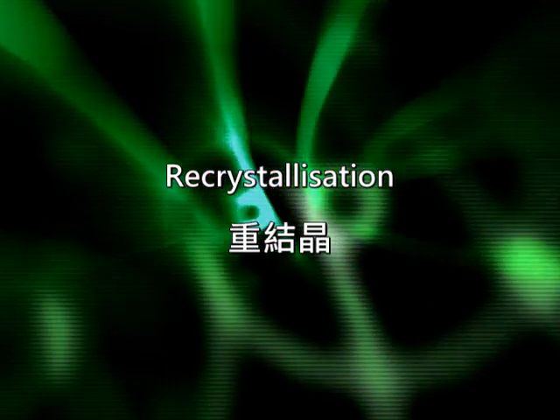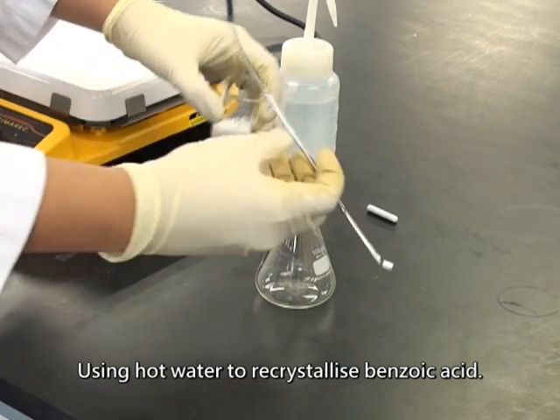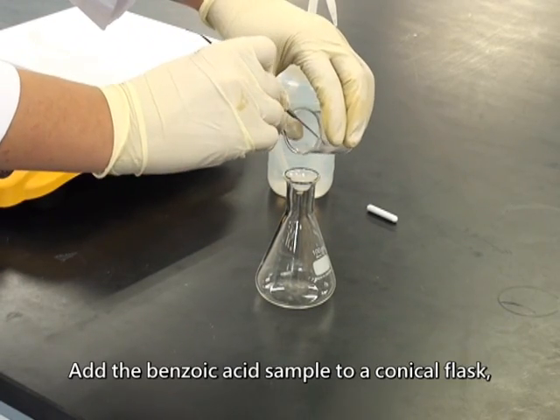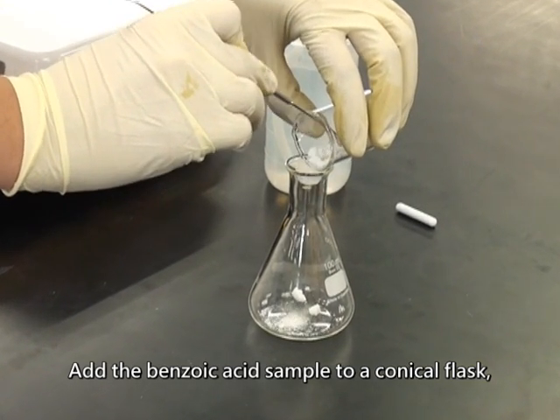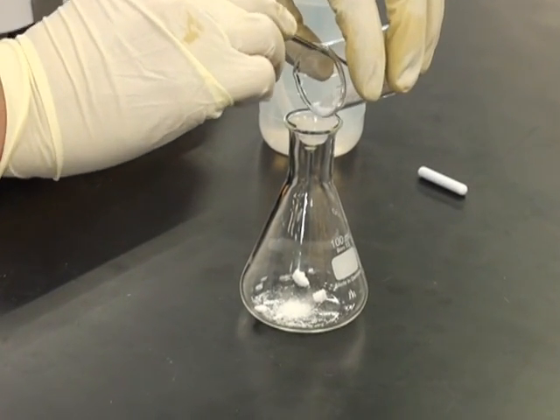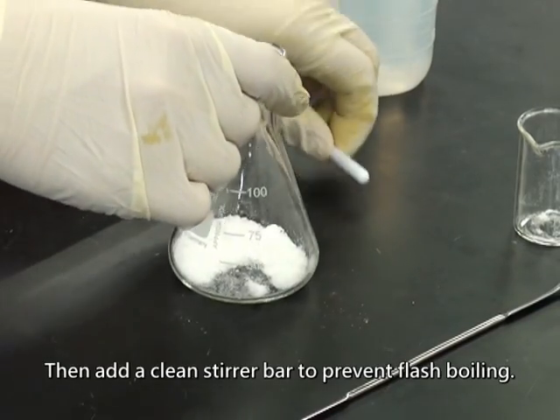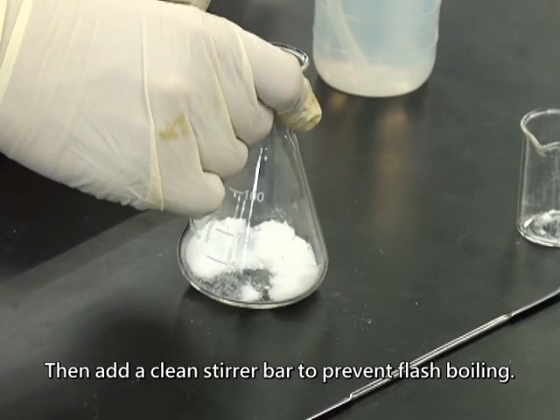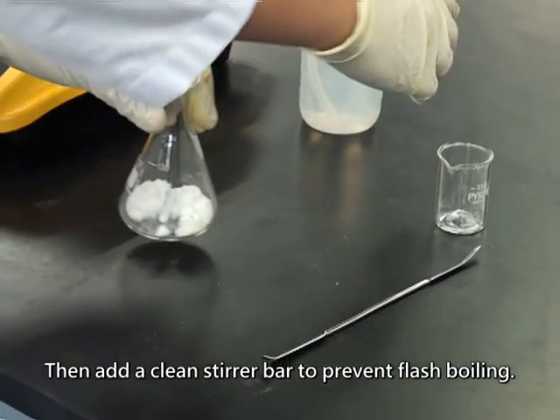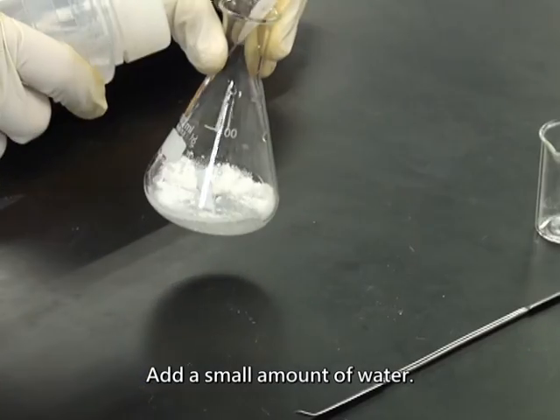Recrystallization. Using hot water to recrystallize benzoic acid. Add the benzoic acid sample to a conical flask. Then add a clean stirrer bar to prevent flash boiling. Add a small amount of water.